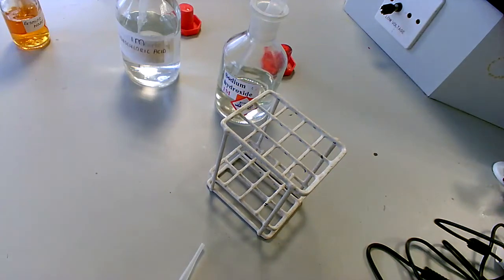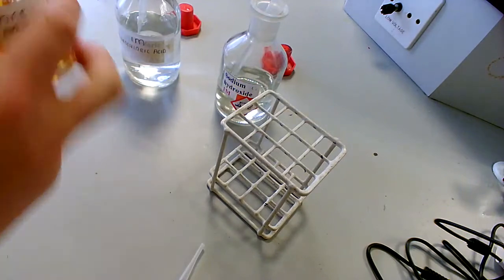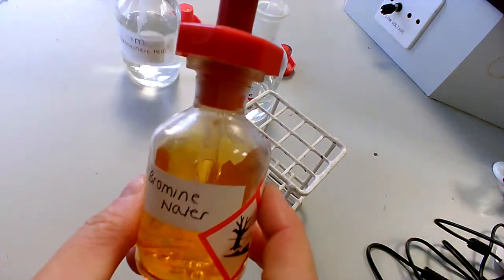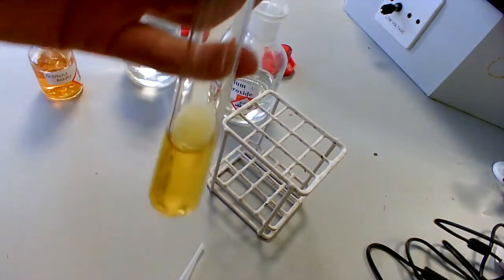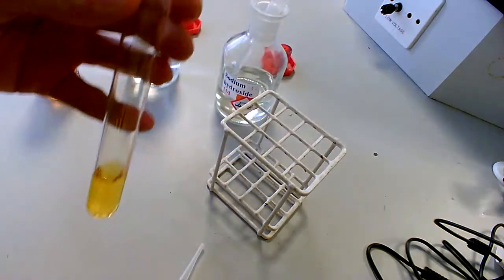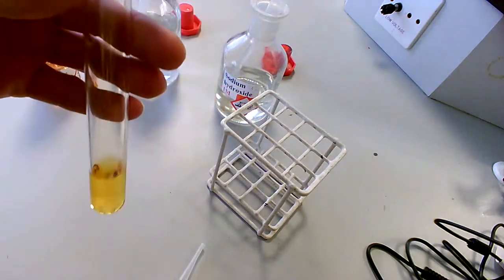Hi year 12, this demo is just a quick one. So we're starting with bromine water, not very nice stuff. I've just put about 2cm depth of the bromine water into my test tube.